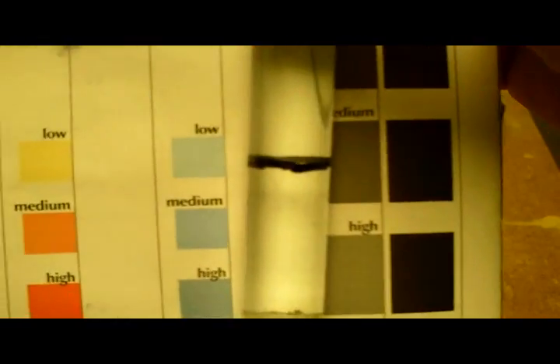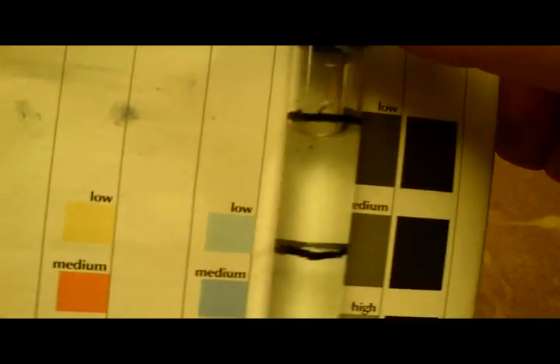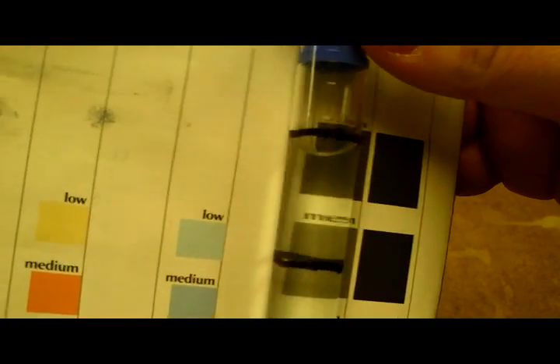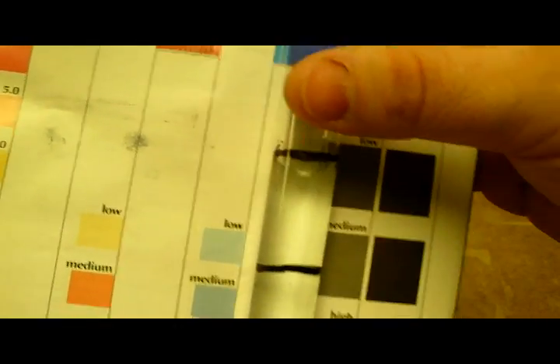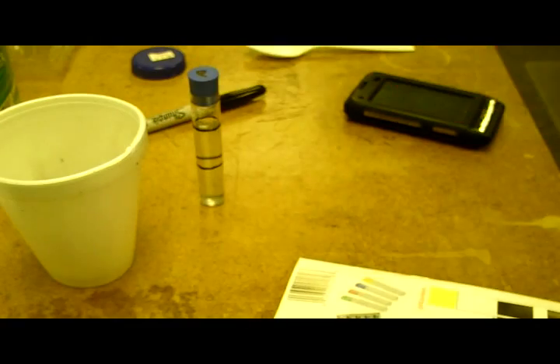It's been well over five minutes. Here's our phosphorus test — we're supposed to match a color up there. I don't even see a color. I'd say low, because it's not very blue at all — just a very, very slight blue tint. So, essentially zero phosphorus.